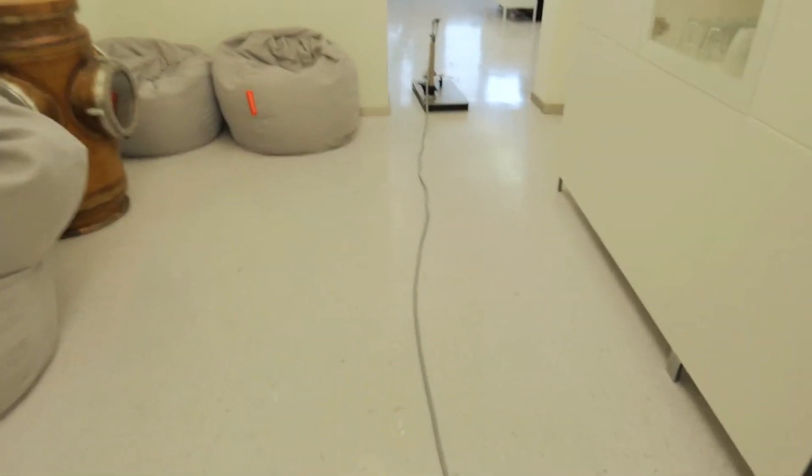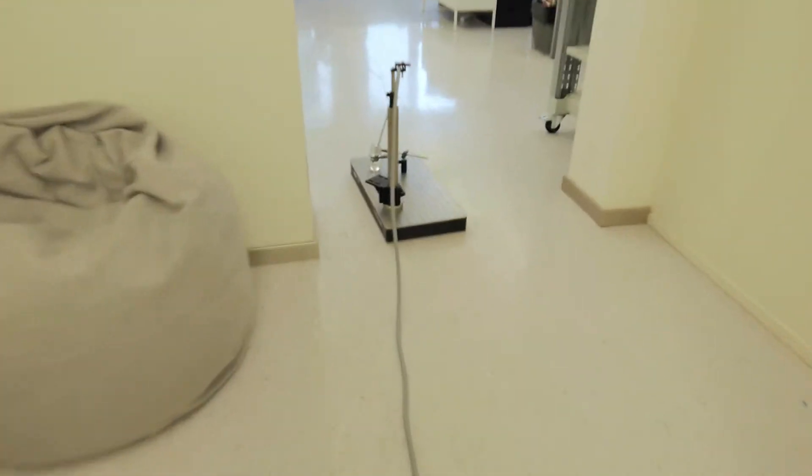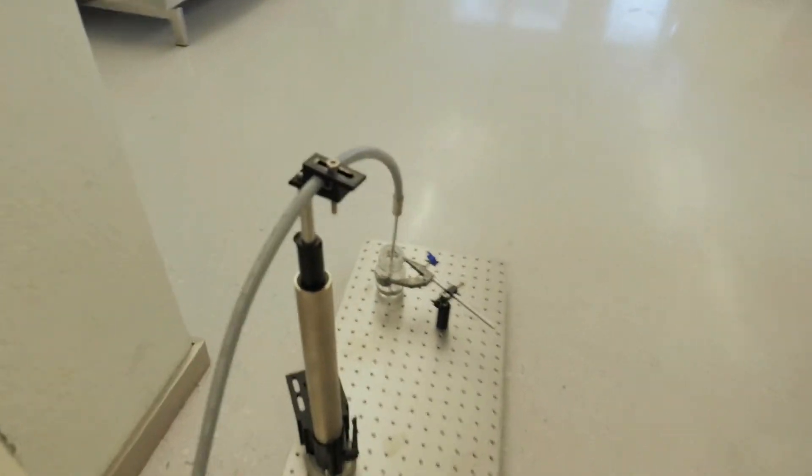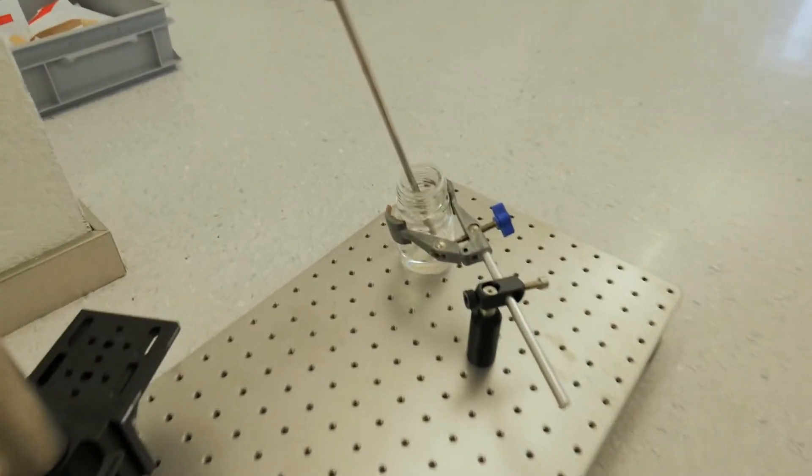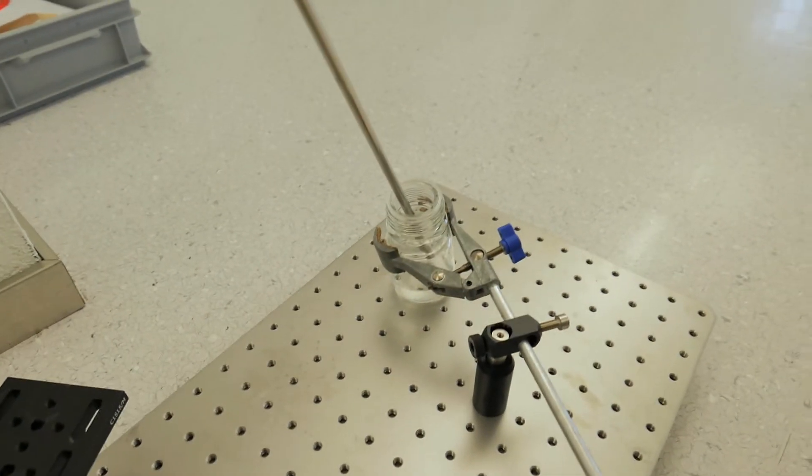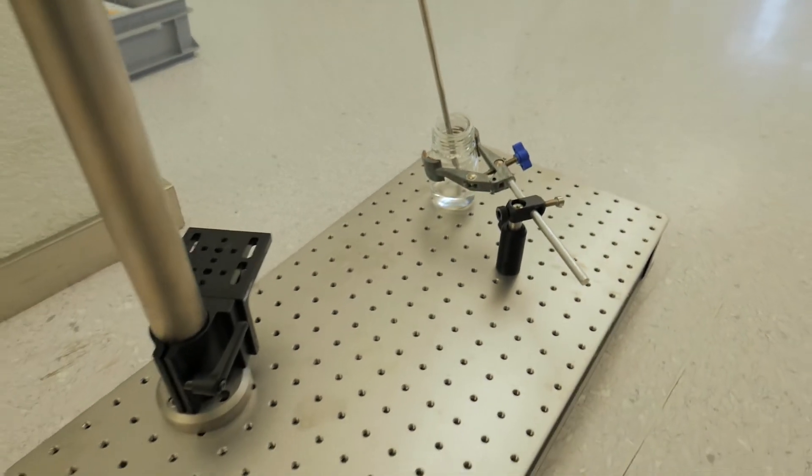So it goes from the application engineering lab through the IR Sweep hallway and into the main office. So we're actually doing the measurement here that you saw on the screen before. You can see there's the ATR probe which is at the end of the fiber which is probing our solution.